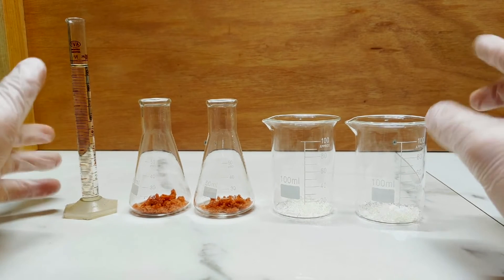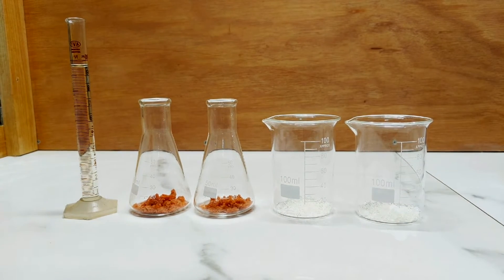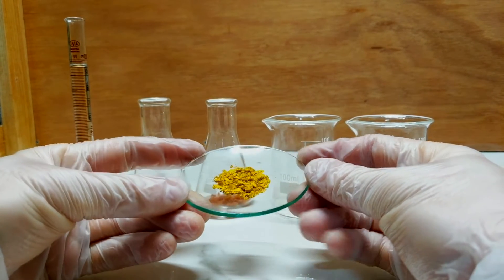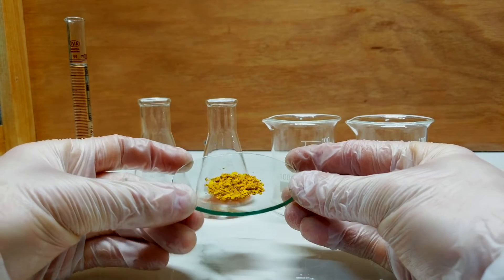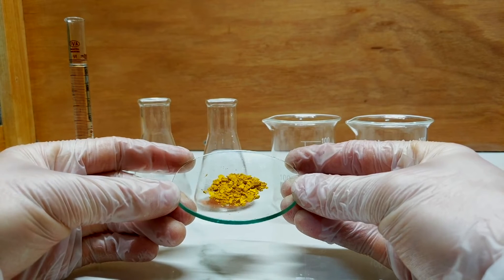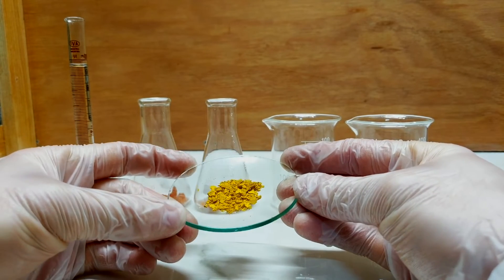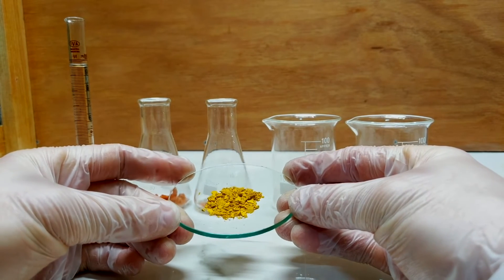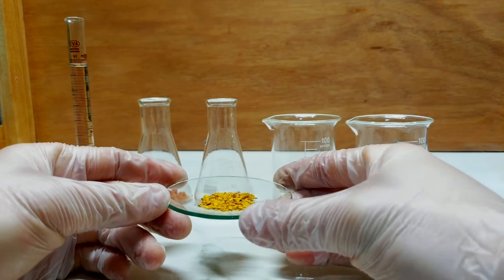This will be, I think, only the second time I've attempted to synthesize this, and the first one I yielded some — this was the first little test sample that I yielded from when I was figuring out if I could even do this. This yellow seems to change colour quite drastically under different lights. It seems to me like this sort of semi-mustardy, bright kind of yellow, which has some desirable characteristics. I've never painted with a cobalt yellow before, and I only really realised it existed recently through some research.